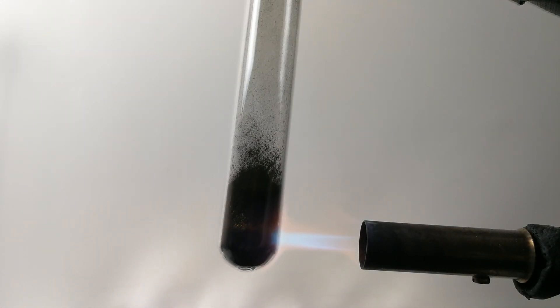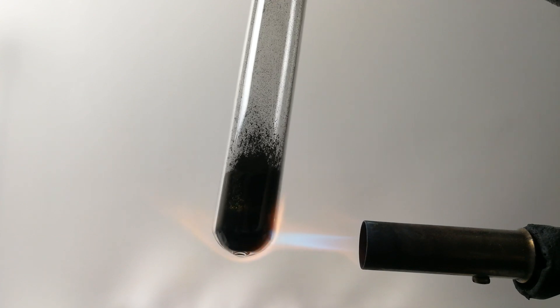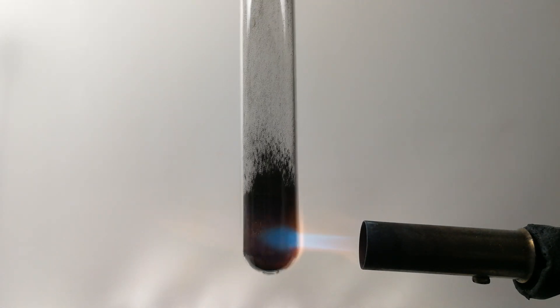Now let's try to scale up this experiment by taking a larger amount of ferrous oxalate. The result is much more impressive.